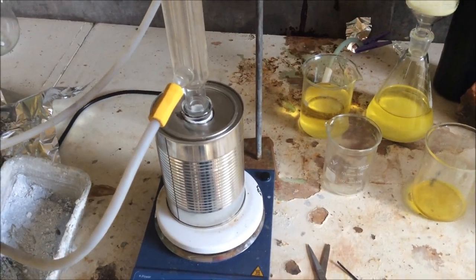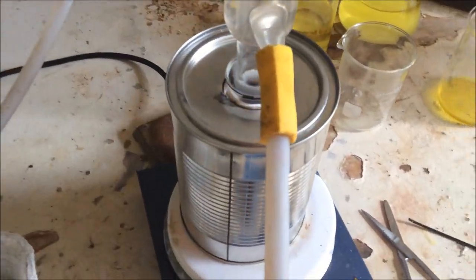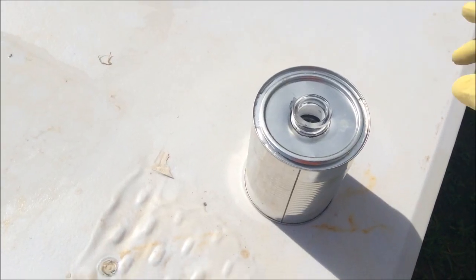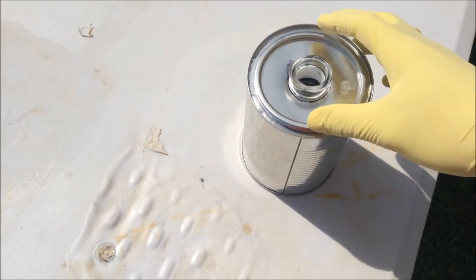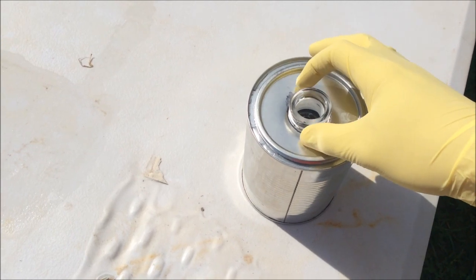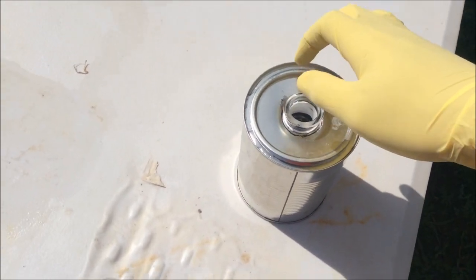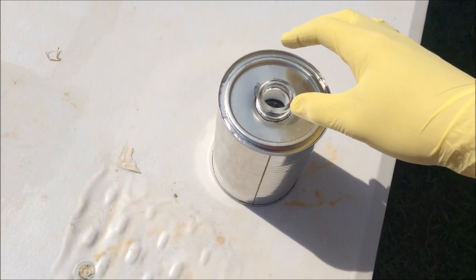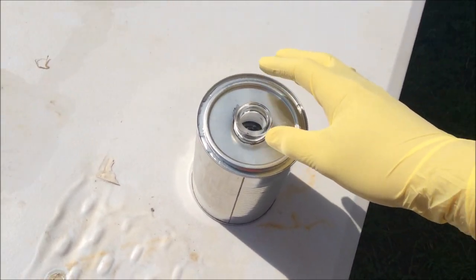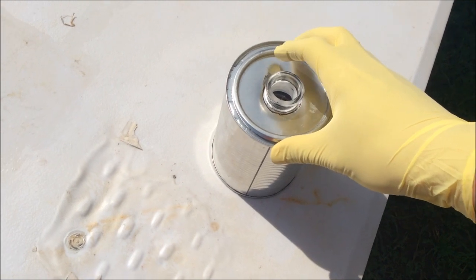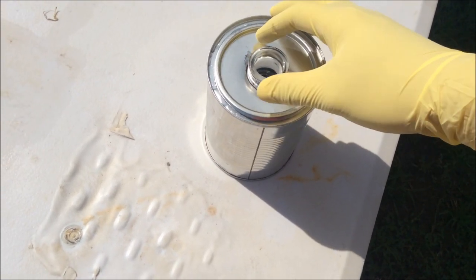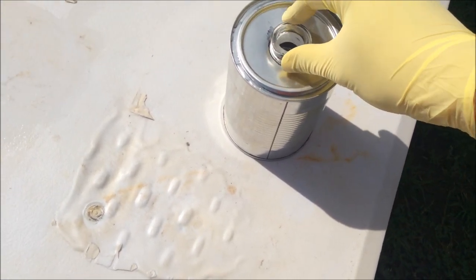So I ended up refluxing it for about four hours. So let's finally crack it open and take a look what's inside. So as soon as I took off the condenser there was quite an unpleasant smell coming from this. It's not really that strong, but it's vaguely familiar. It smells kind of like if you took a fish and wrapped it in glad wrap and then set it on fire and then left it out in the sun for about three days. That's the kind of smell we're getting. It's like a combination of fish and burnt plastic.